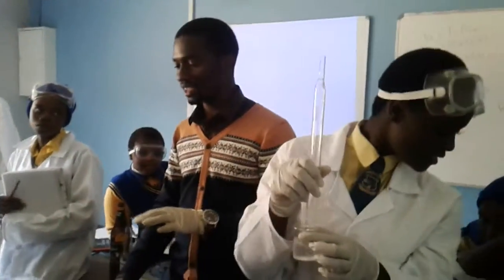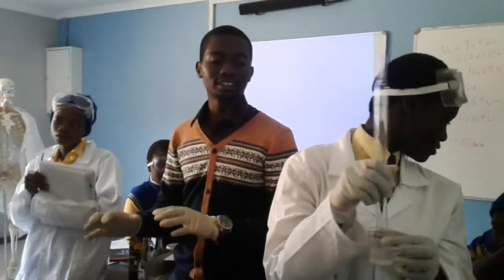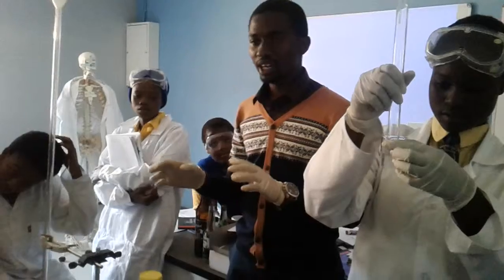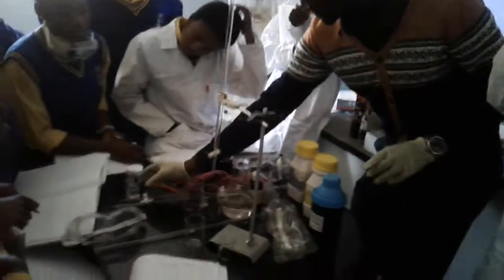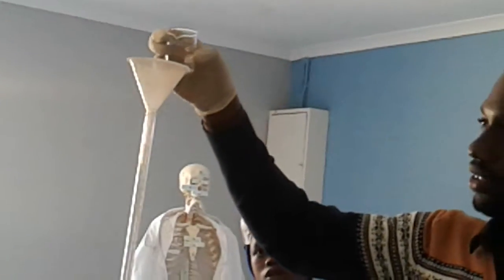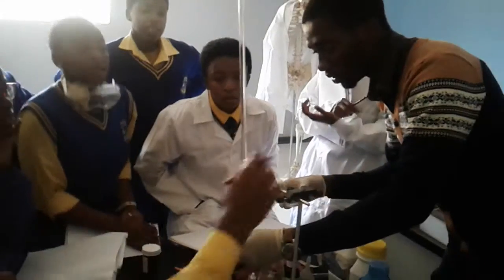That's why I said you guys are gonna use a scale. Okay, I'm just showing you how to do it. Alright. So now what you're gonna do? Guys, you struggle with the reading. What do I have here? Okay, let me show you how this thing works.